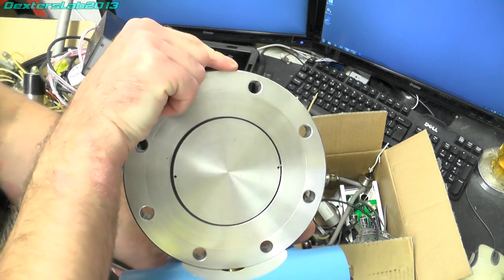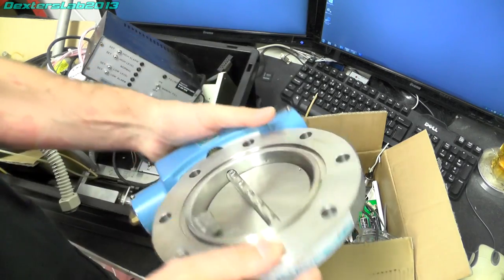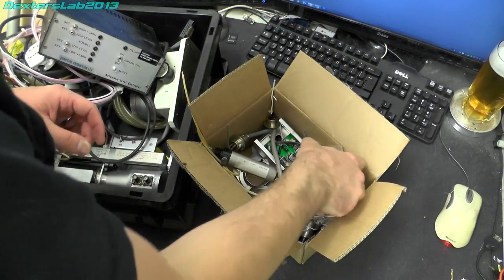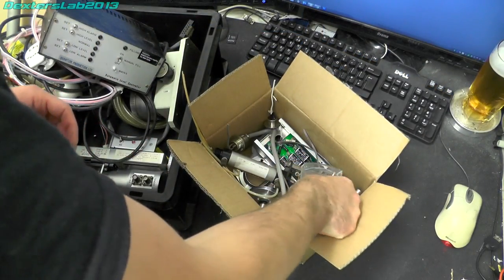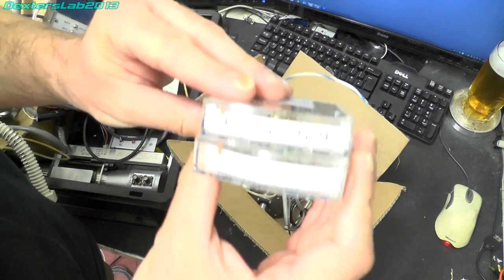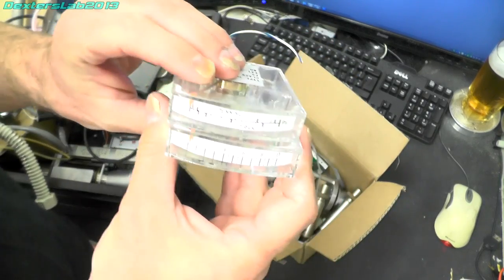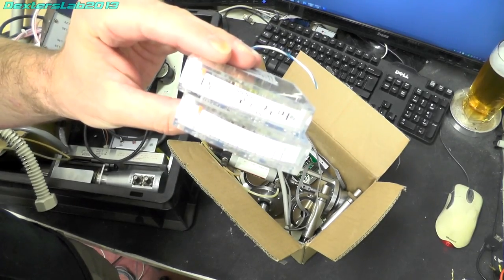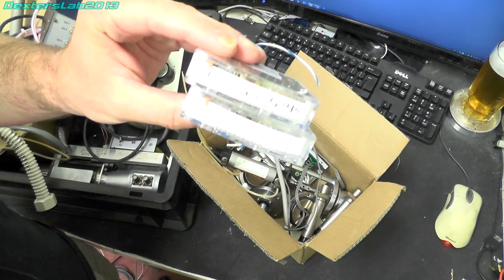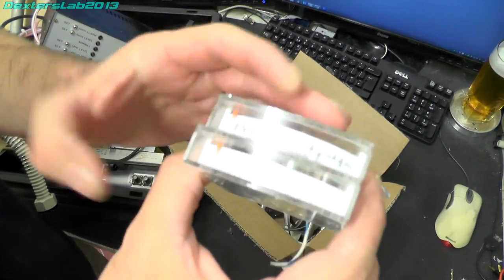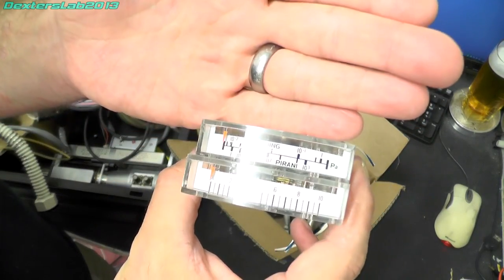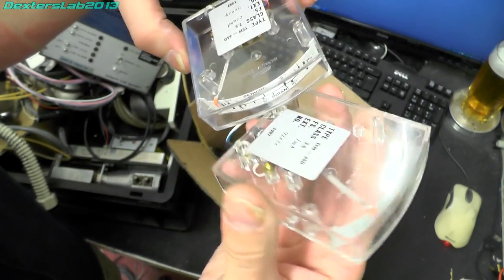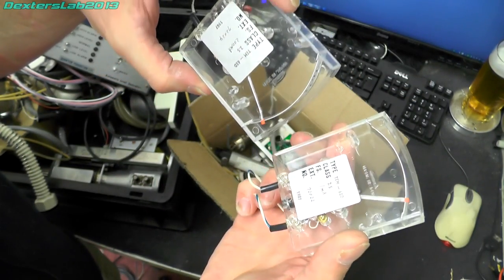So nice lovely bit of engineering on that. Also in this box we've got the two panel meters, let's just turn the brightness down here for you.